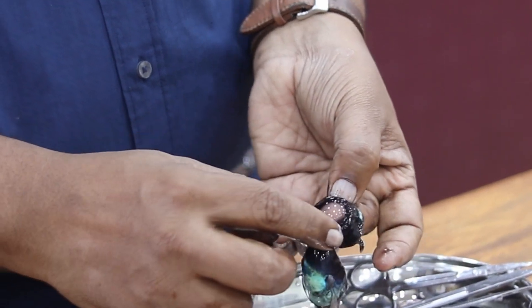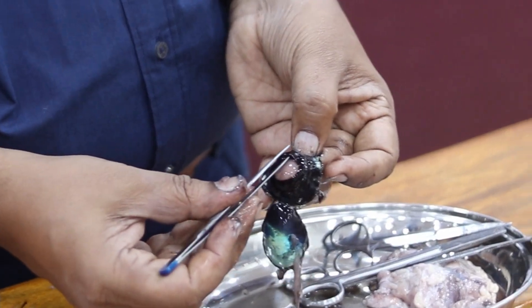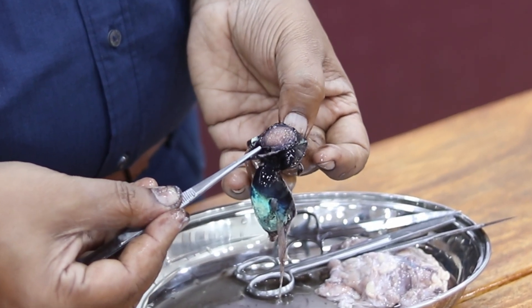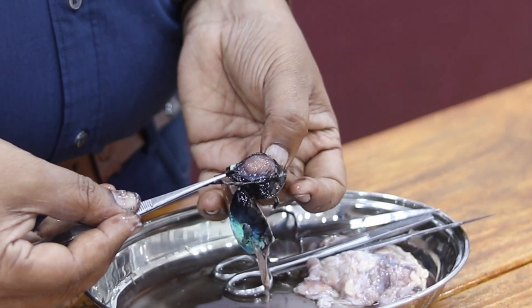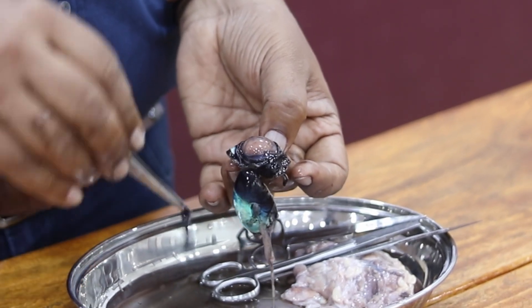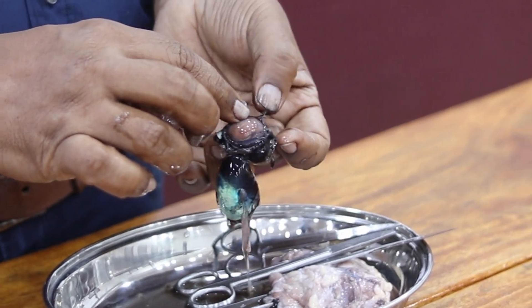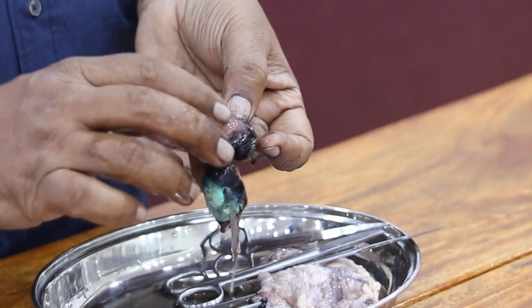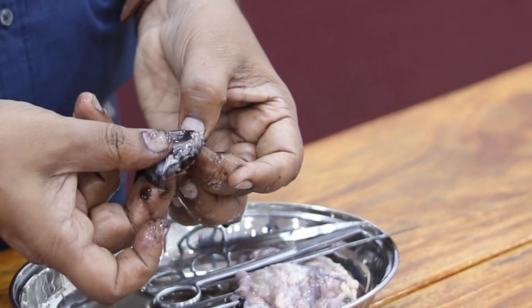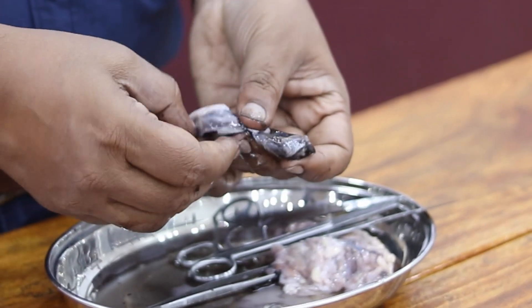It's difficult to show you, but this is the ciliary body. I can remove the ciliary body and show it — this one is the ciliary body. The lens is held by suspensory ligaments to the ciliary body. In front of that is the cornea — a transparent cornea. You can see my finger from the other side through it. This is the cornea; it's a double-layered epithelium.